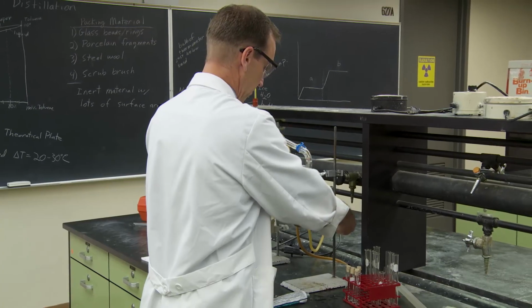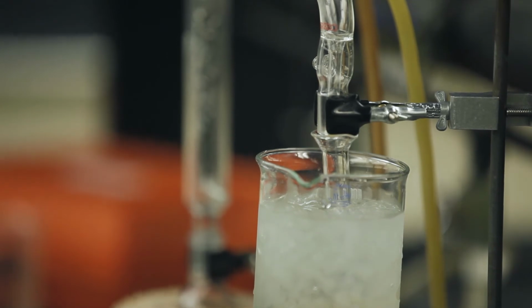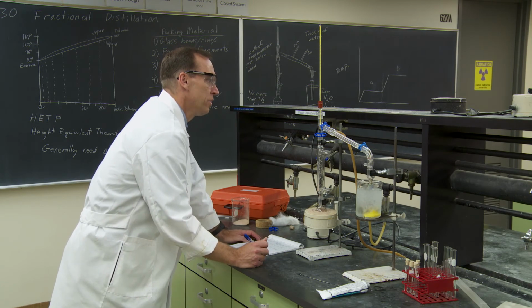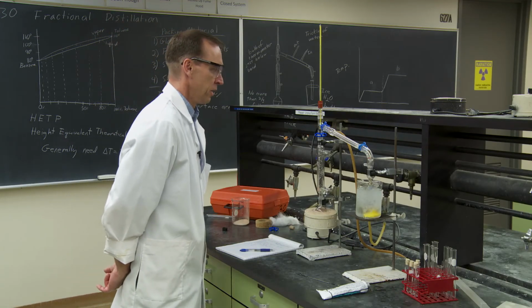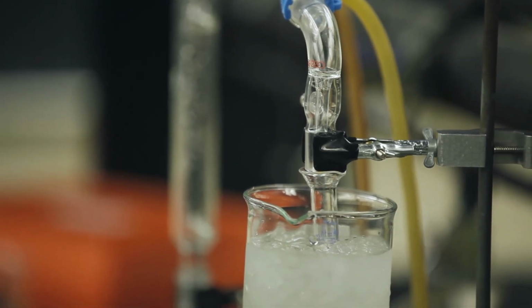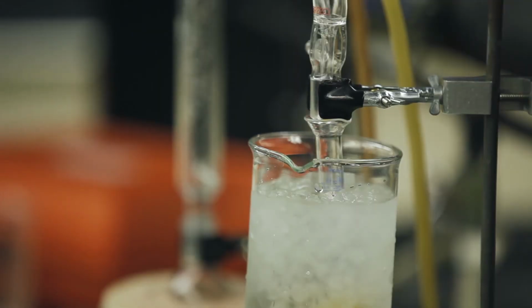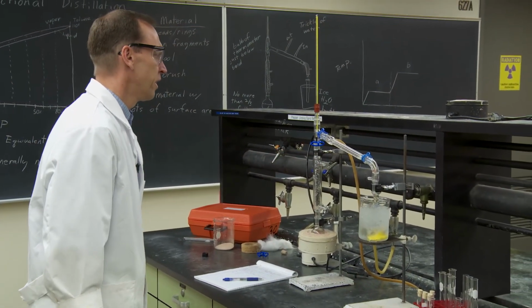Go ahead and raise this up a little higher. So about 1 milliliter into my second fraction, I'm at about 74 degrees. I know that everything left in here is my second component. The only question is where the plateau will occur, just to see how high my temperature will go. It looks like it's holding fairly steady at about 74 degrees. Okay, so after about another milliliter, I'm still at 74.